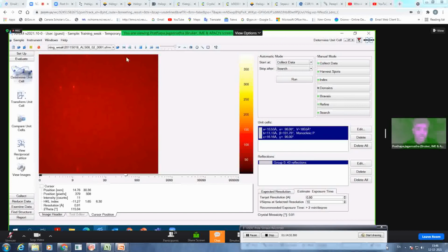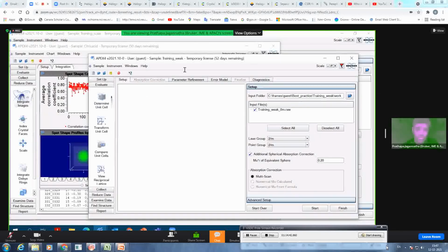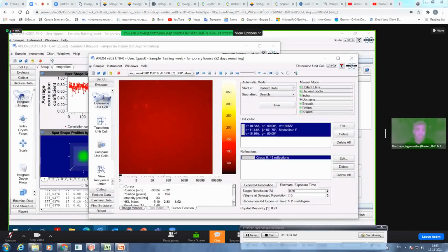If you look at this data, you see this is very weak data. In the previous case you had lots of reflections, but in this case you can see that the reflections are pretty poor or weak. The resolution is also around 0.95 maximum. Below that you don't see anything. Up to 0.95 you can see resolution. With this kind of data, if you use the default values, then you are in trouble.